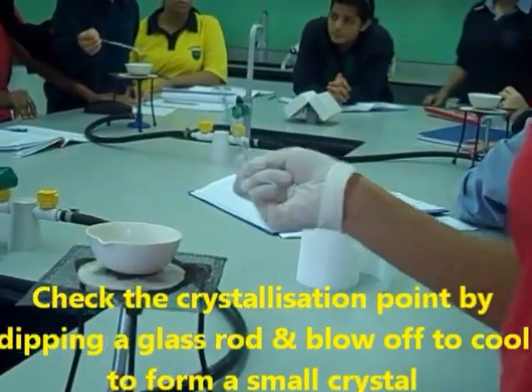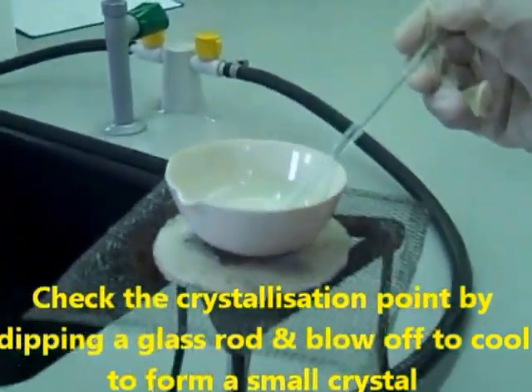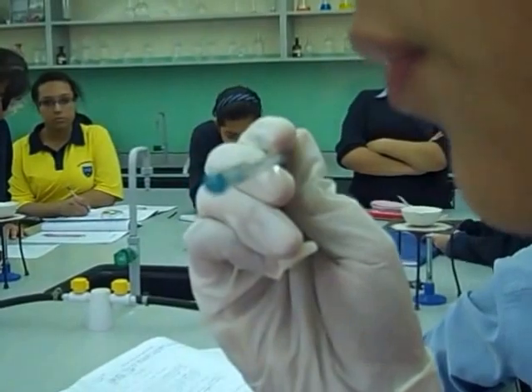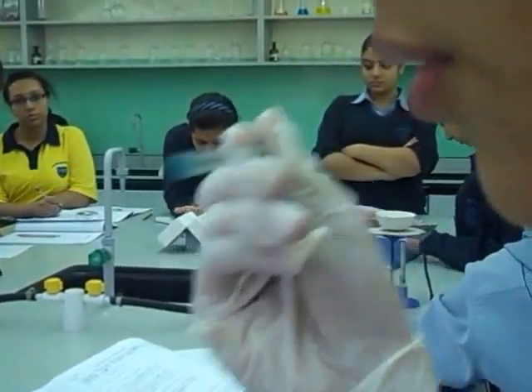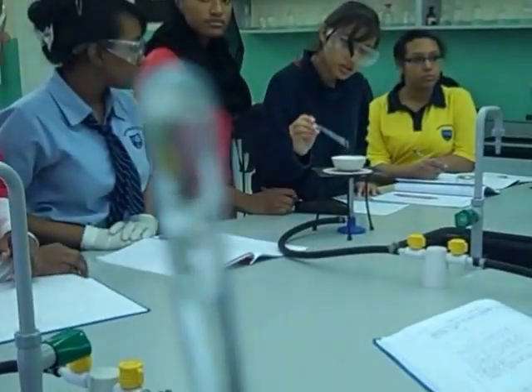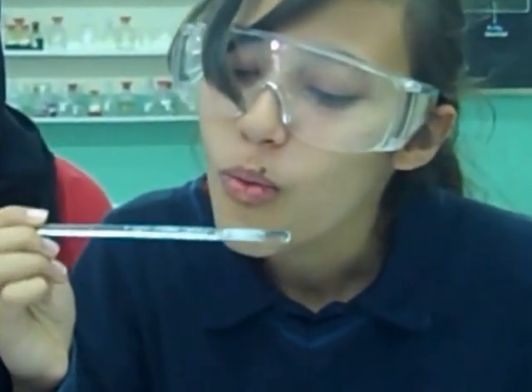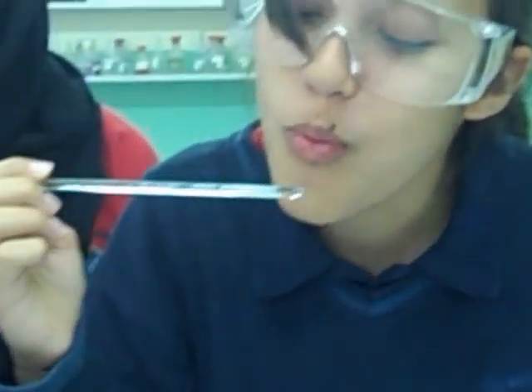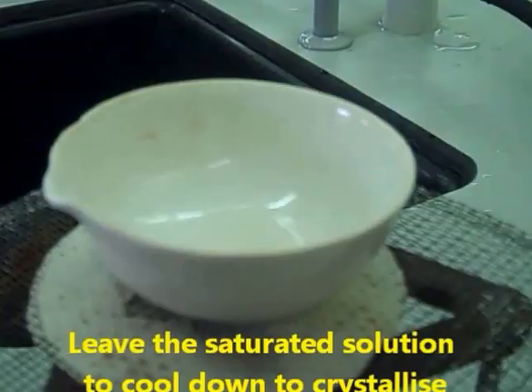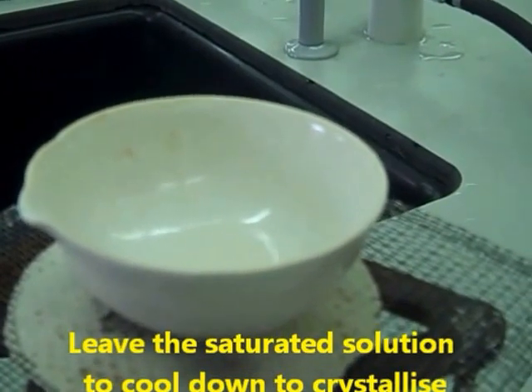Now we check the crystallization point by dipping the glass rod and blowing off to check for the crystallization point. Here the crystals are formed. Now we cool down the saturated zinc chloride solution.